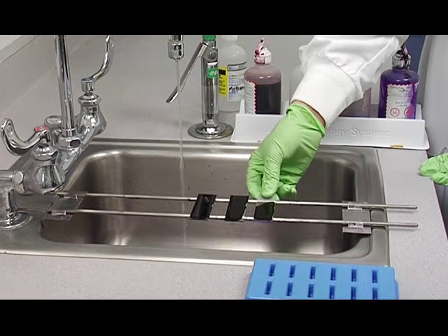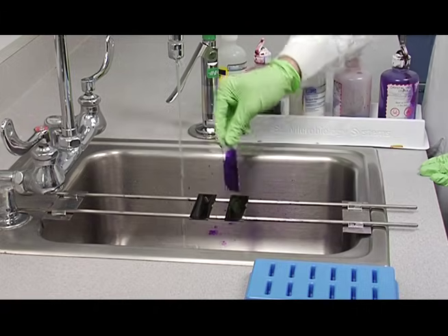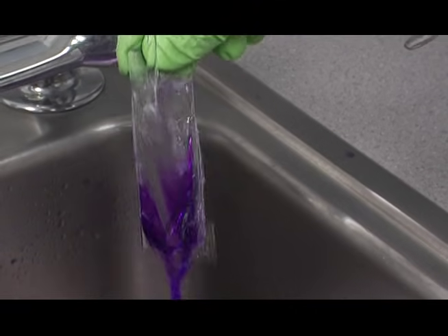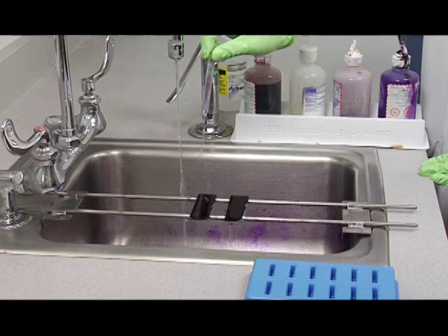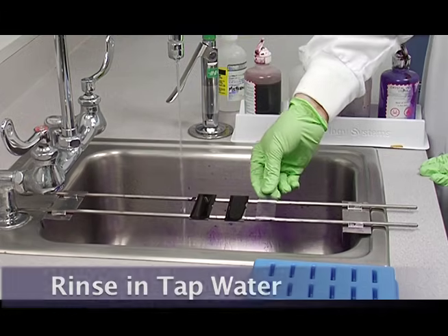After the 30 seconds with the crystal violet, dump the crystal violet in the sink and rinse it off until the crystal violet comes off. Don't over rinse and you can shake off the excess water just like that.